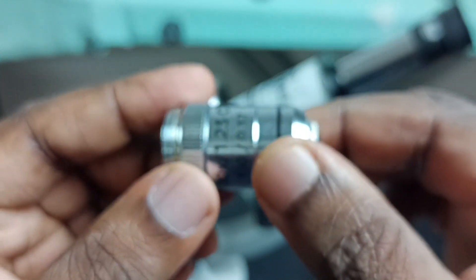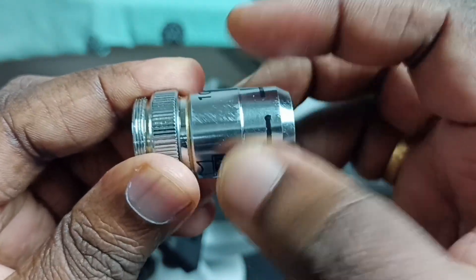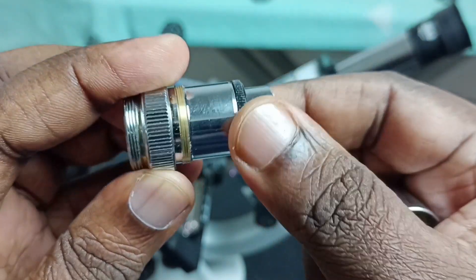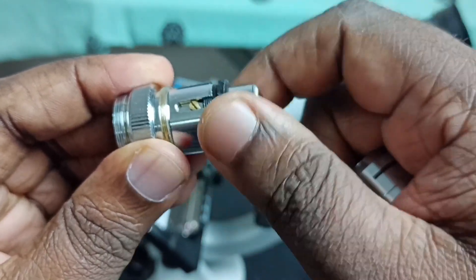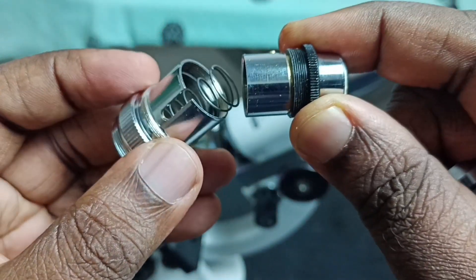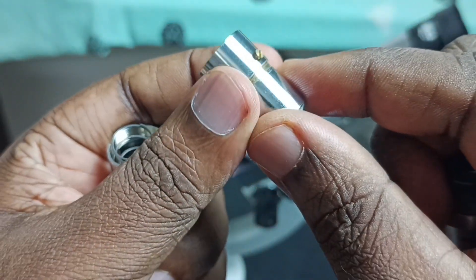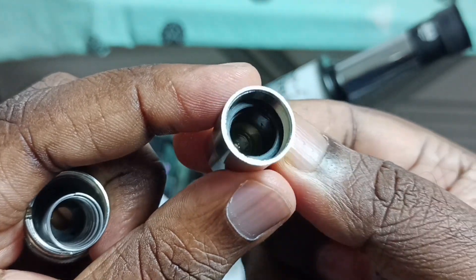Let me open this. This plastic we can remove. There is a spring inside. This is the lens, so we can remove the screw. That way we can take the lens outside. These are the parts.